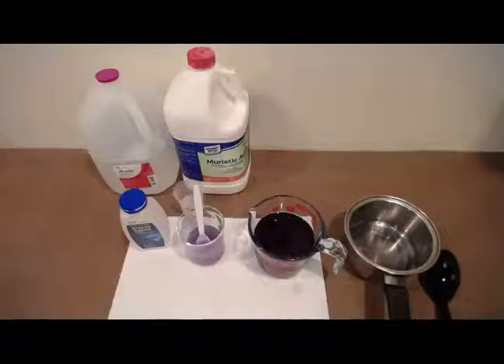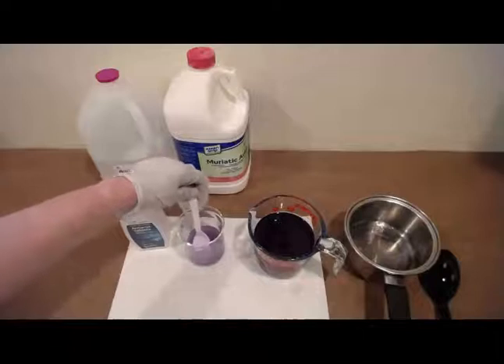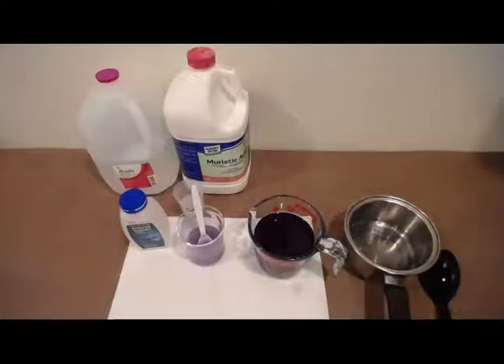Now, step 12 says, once the tablet is gone, note the color. If you do not see purple or blue, add another tablet and continue to stir. Your goal is to get the solution to be purple or blue, which we have successfully done here. Step 13 says, once you get to the purple or blue color, add another teaspoon of the toilet bowl cleaner. And then what happens? So what do you think is going to happen when we add another teaspoon of that toilet bowl cleaner? What is your hypothesis?